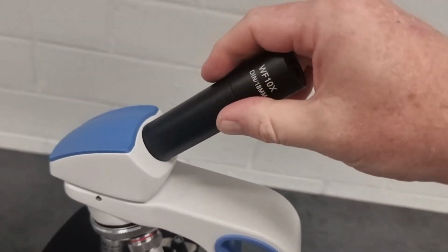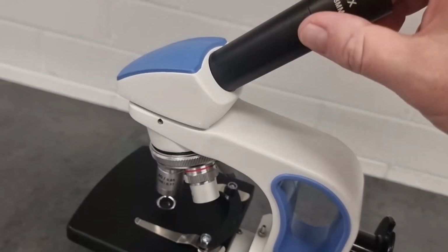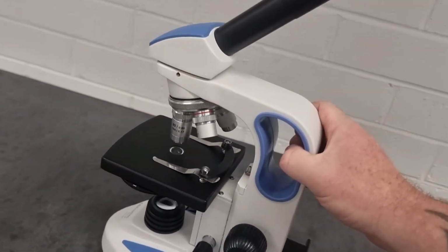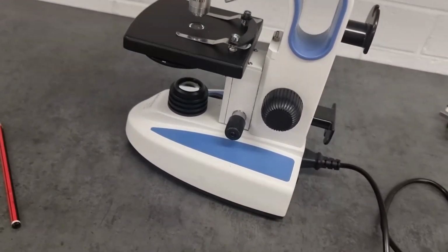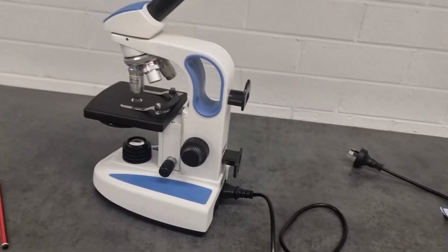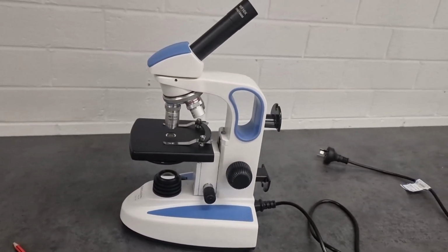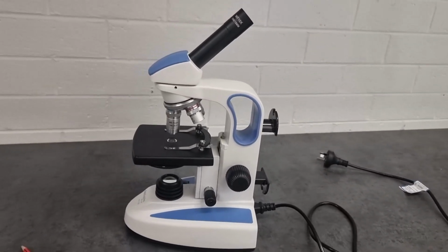Definitely don't grab it by the top. These eyepieces come out, so don't just hold it by the eyepiece. The rest of the microscope will smash on the ground. Hold it by the arm and your other hand underneath the base. So carry it with two hands when you're walking around the lab, please. And that, I guess, is a basic introduction to a compound microscope.